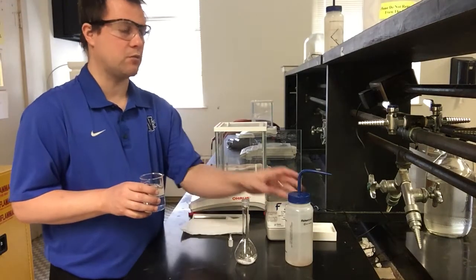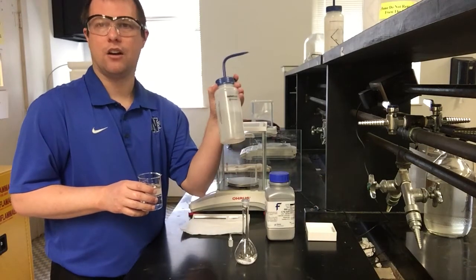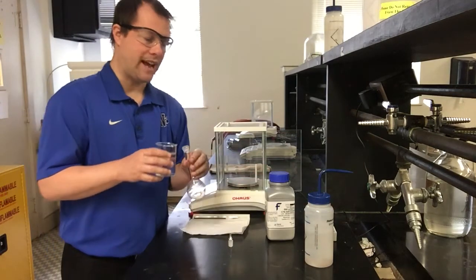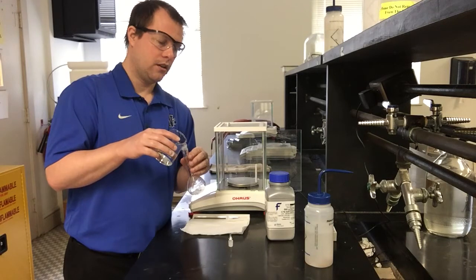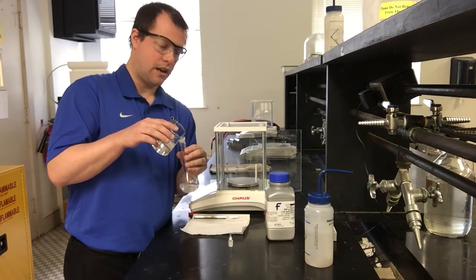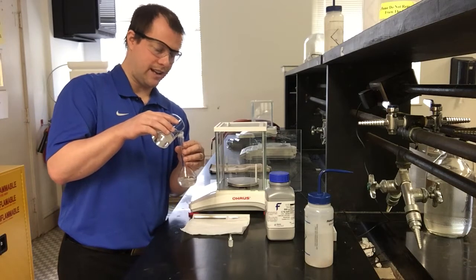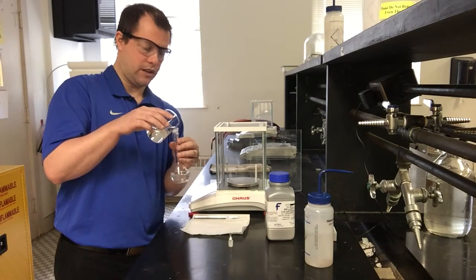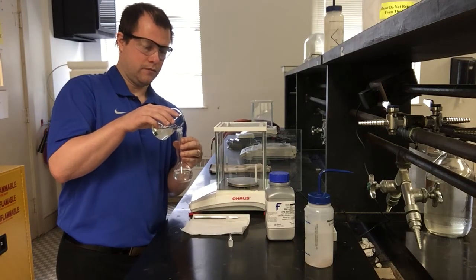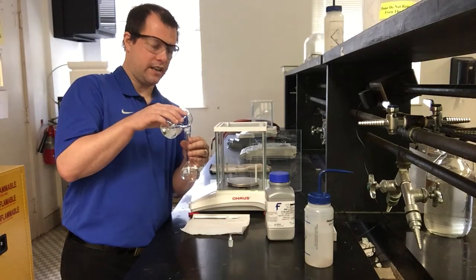This is deionized water, and in any of our labs, our squirt bottles are always filled with deionized water that you can use as well. So that's what we're going to be adding here. Again, I'm not going to fill this all the way up to the line right away. I basically just want to fill this maybe to the start of the neck in terms of the liquid level, and then I'm going to mix everything up real good.